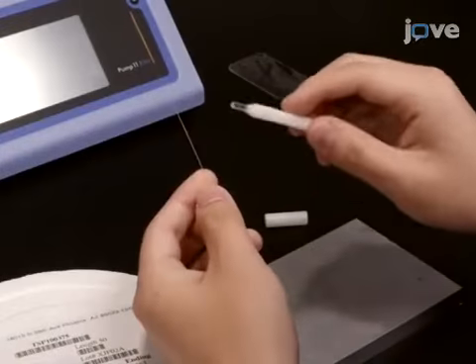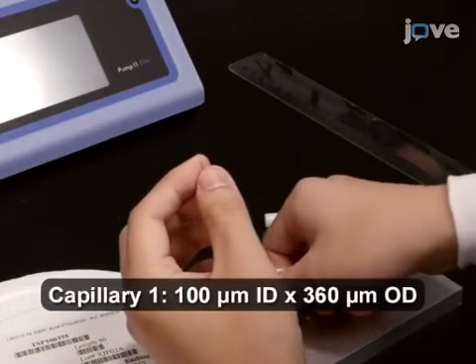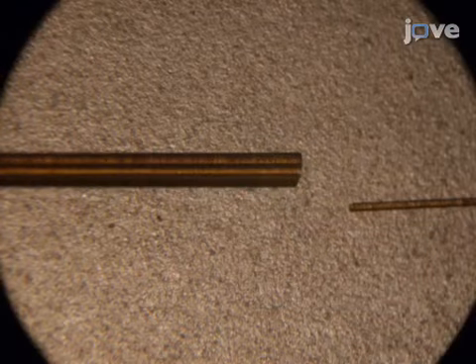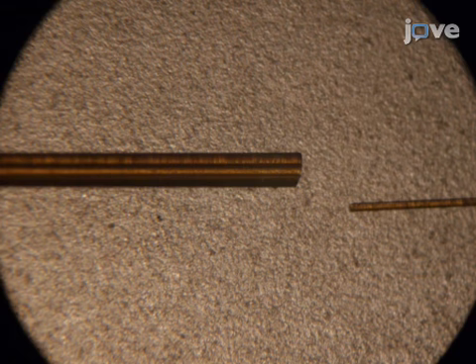To begin, use a glass capillary cleaver to cut the larger glass capillary tube to a length of 7 to 8 centimeters and the smaller one to a length of 3 to 5 centimeters. Use a microscope to verify that both capillary ends have a clean, straight cut without any protruding burrs.